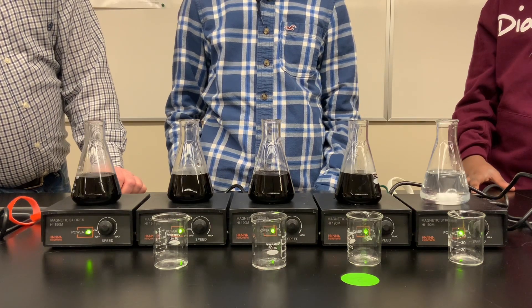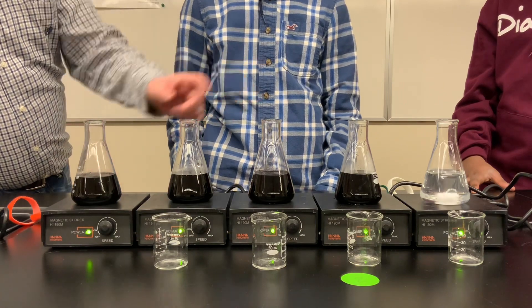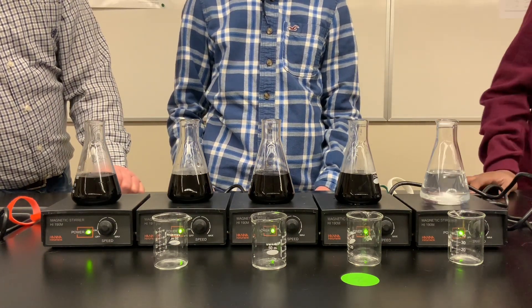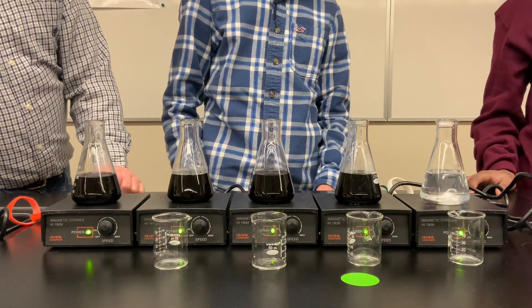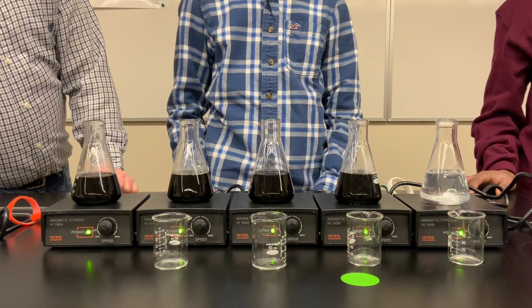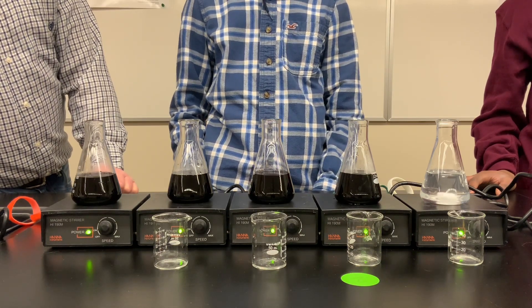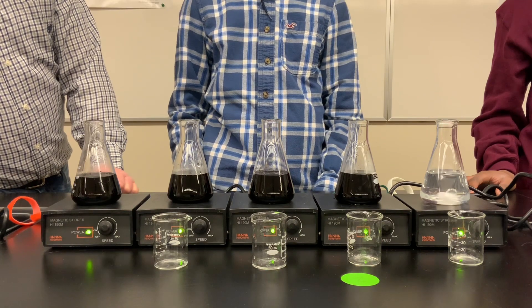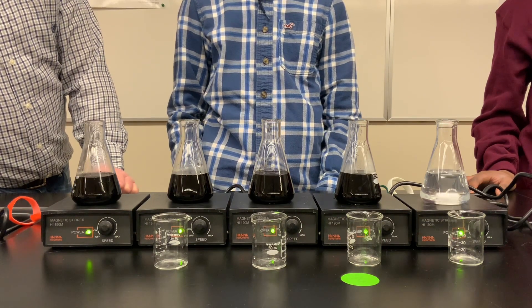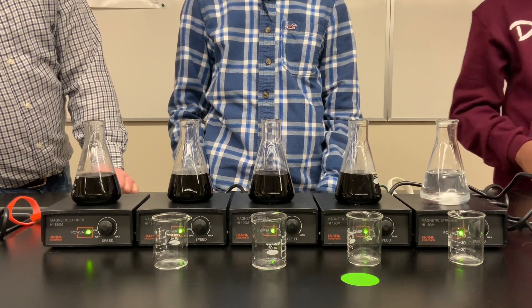If you have your average rates and the concentrations of bisulfite in each of the five flasks, you can create a graph and examine the effect of changing concentration on the rate of the reaction. That last flask has the least concentrated bisulfite, so not surprisingly it takes the longest. But as one of my students said, you simply have to have faith in chemistry and the reaction will occur.